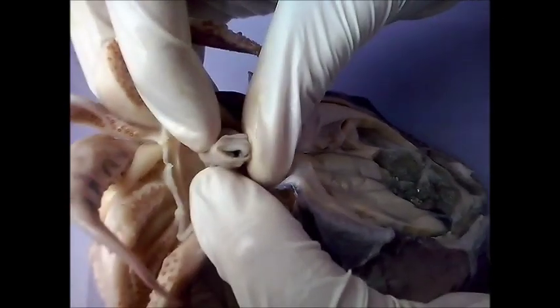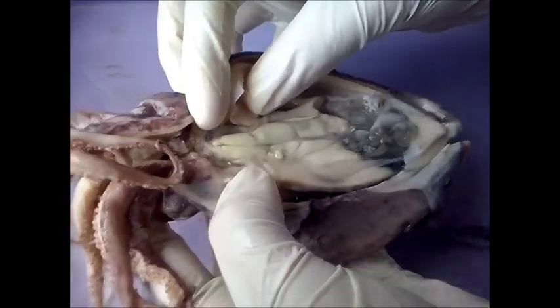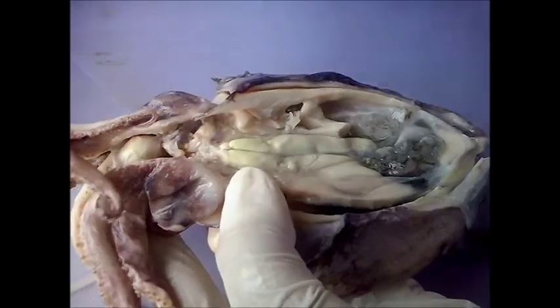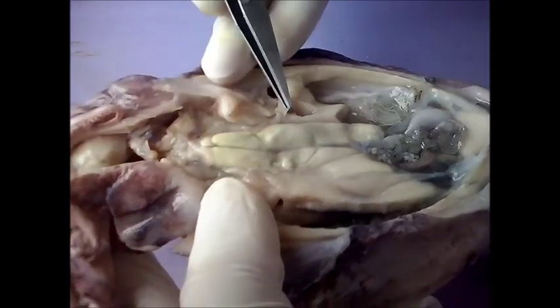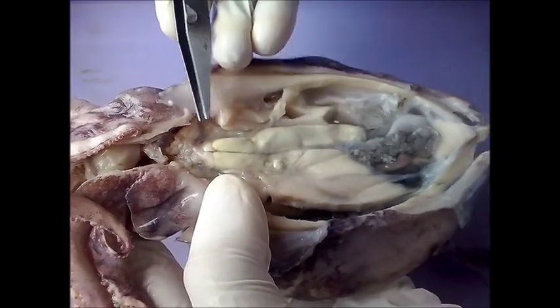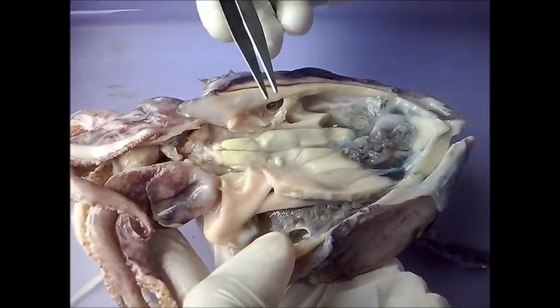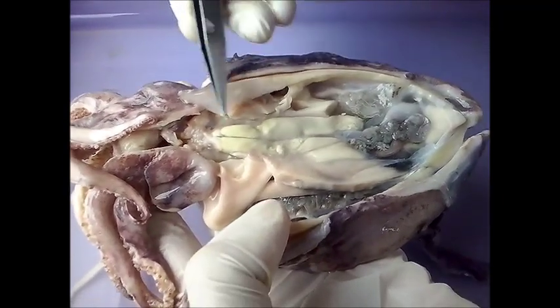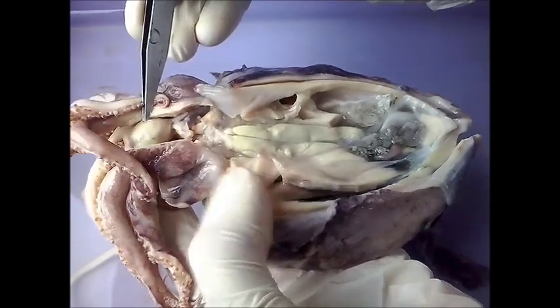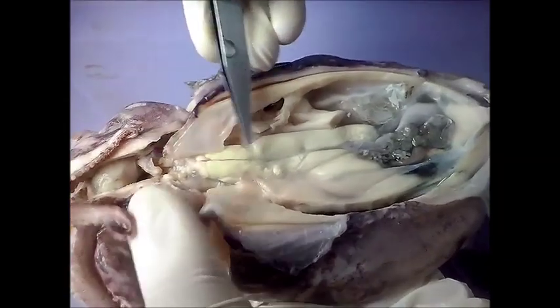The mouth then progresses into the buccal mass, which is joined inside the viscera through the esophagus. As soon as you expose the viscera, all the systems present inside the animal will suddenly be visible. We will trace the digestive system starting from the mouth, the buccal mass, and into the esophagus.